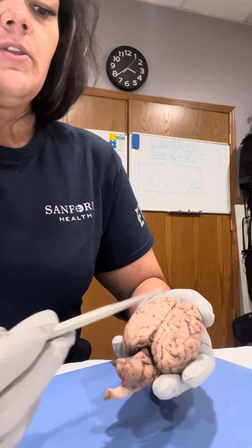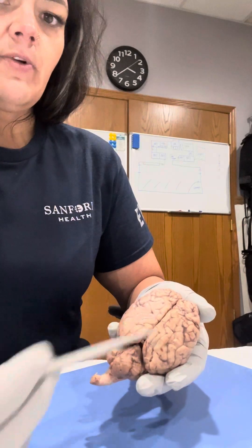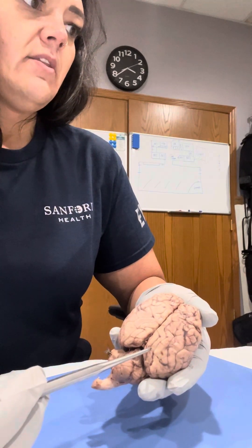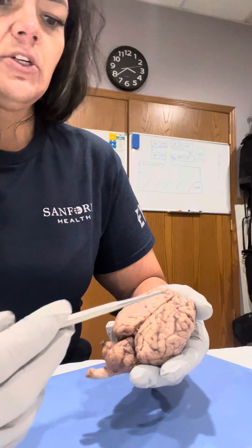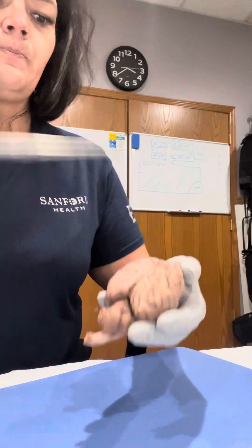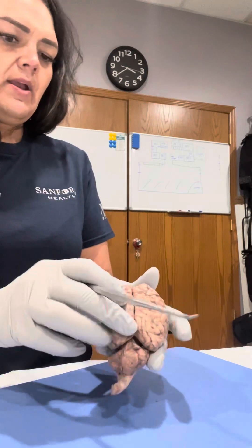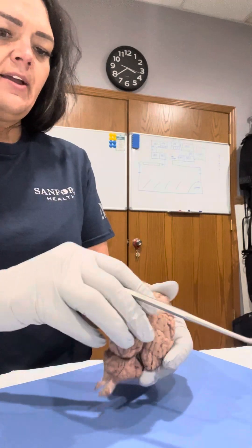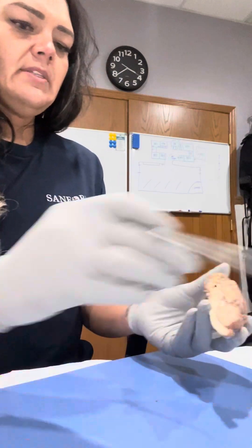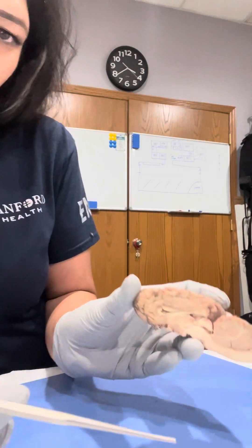So then what I did is I dissected the brain down the medial longitudinal fissure, right in this area here. When I did that I was able to see more.